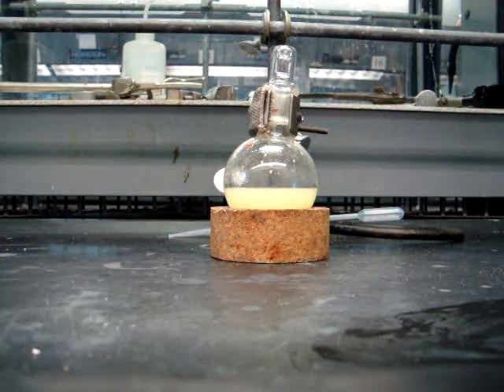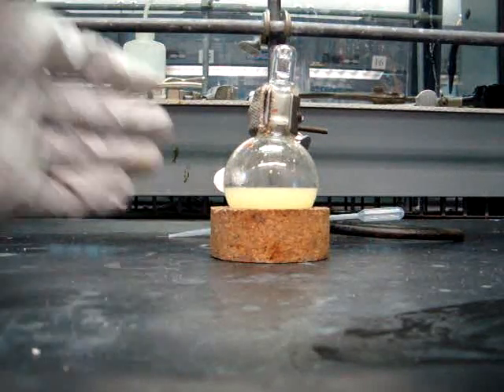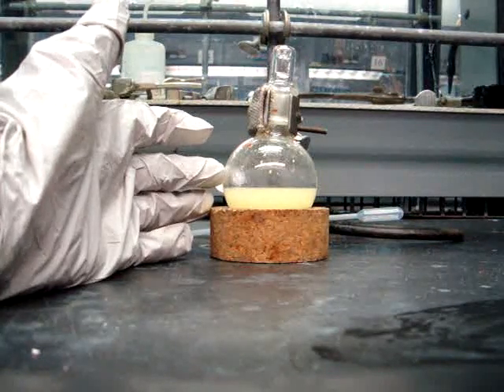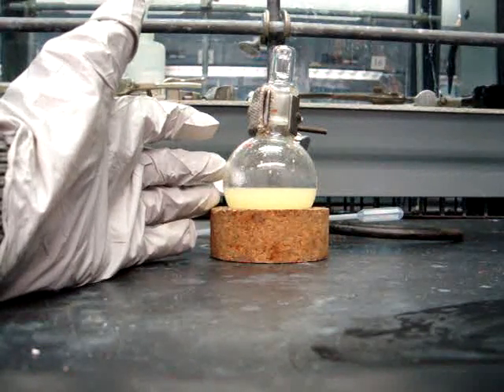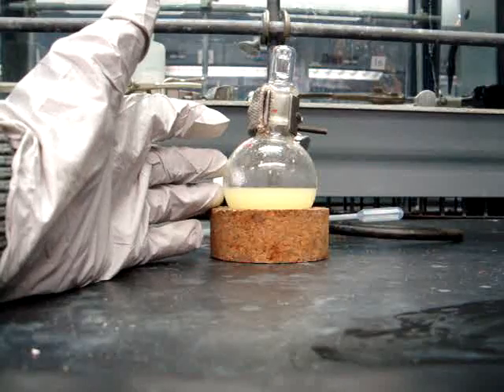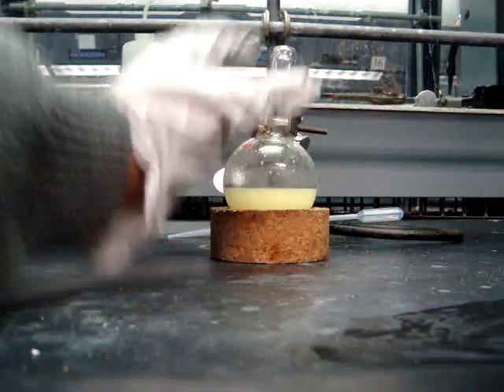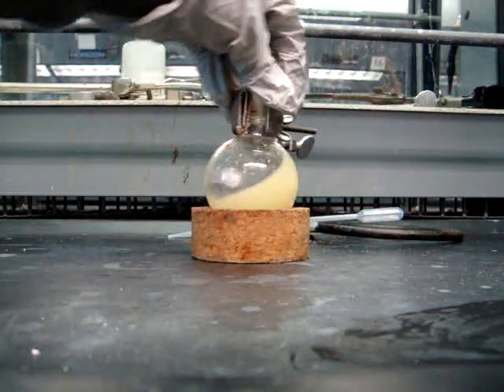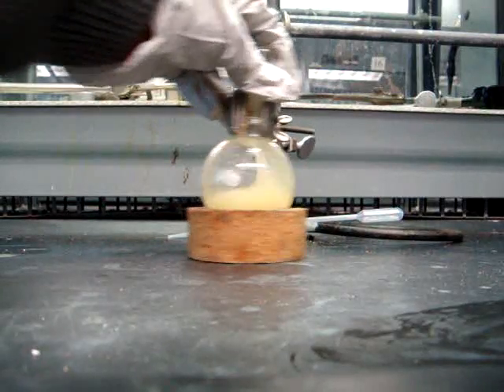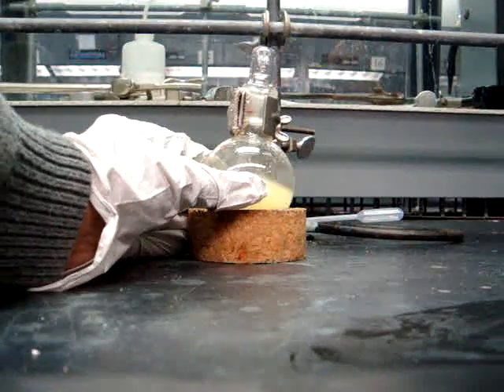As you have seen before, we've already added the benzaldehyde, the ethanol, and the sodium hydroxide. Once you add the acetone, you will continue to shake the round-bottom flask for about two to three minutes, and you will see a yellow precipitate beginning to form.